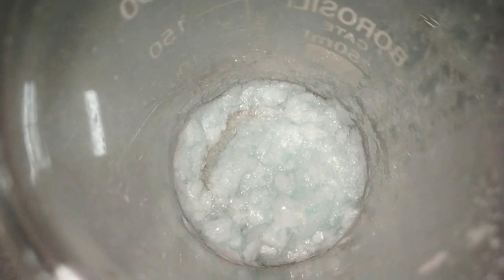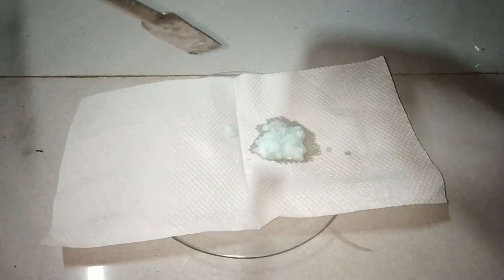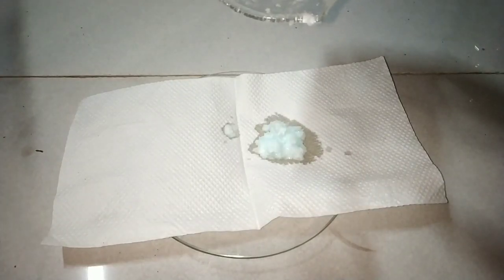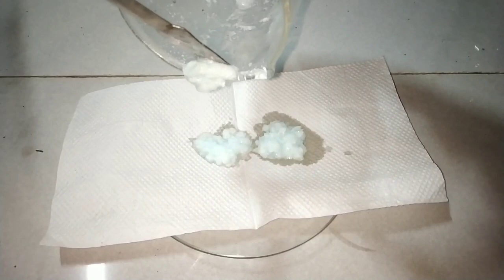Now I will have to dry this salt fast with some tissue paper and then I will be storing it. Don't try to dry it under the sun or under light, it will get oxidized by the UV light. Even drying under electrical lights is not recommended.